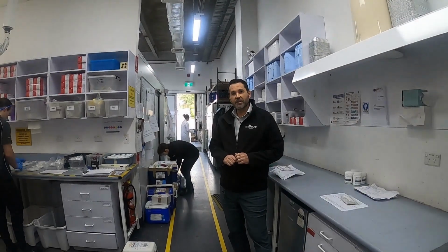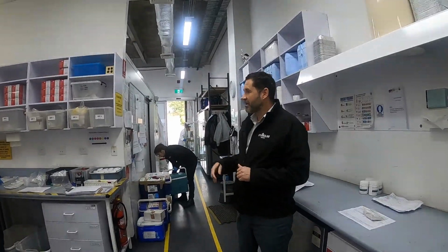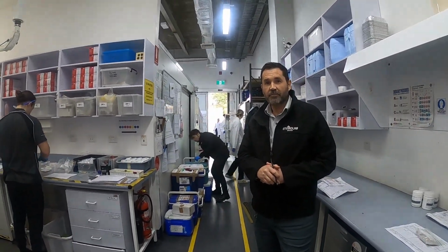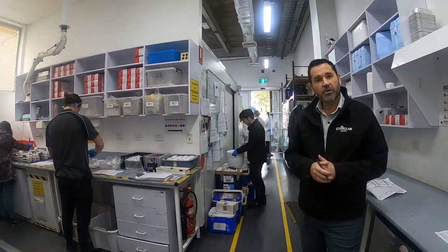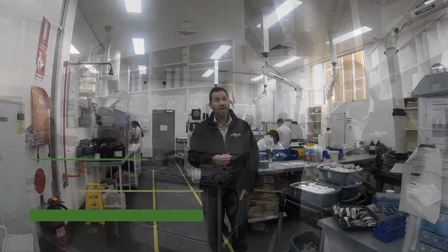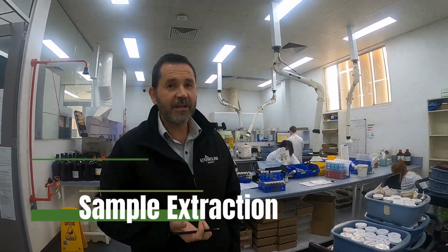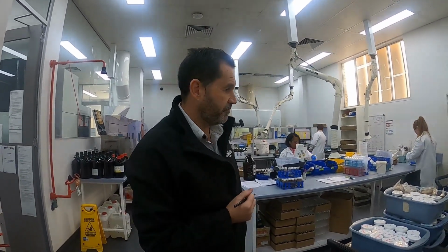This is our sample receipt section where all the samples come in eskies, all with ice bricks to make sure they're cooled. And this is the area where we sort all the samples out. This is our sample extraction area. Now in this area, all the chemists and lab technicians are extracting the samples ready for the instrumentation.